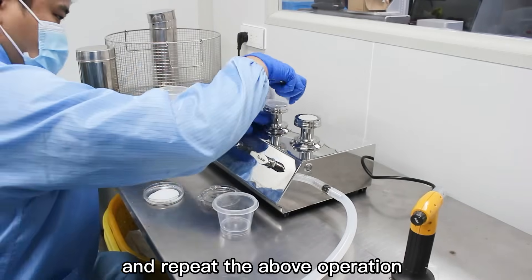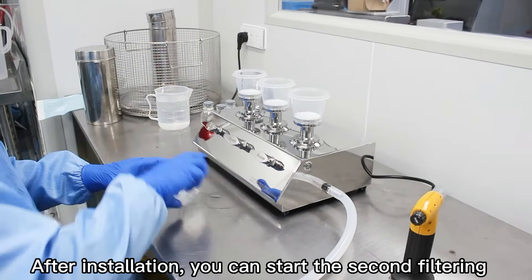Repeat the above operation. After installation, you can start the second filtering.